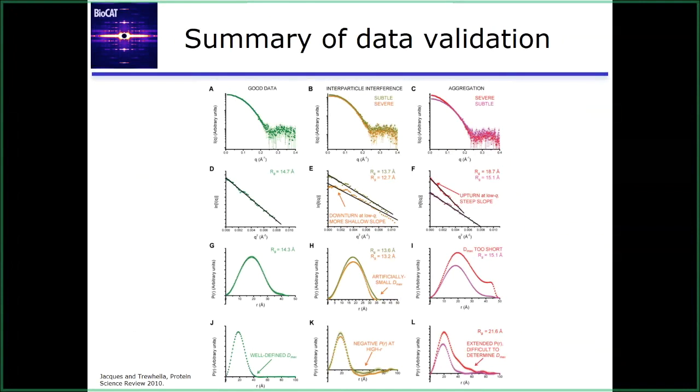That negative dip, is that real? Is that because you actually don't have any particles that are that far away? So the question for the remote users is whether this negative dip in plot K is real. I'd have to think about it a little bit. My instinctual answer is no. It's an artifact of the fact that we're trying to fit a structure factor as well as a form factor with something that's just trying to fit a form factor. So it has to add in some negative density to do that.